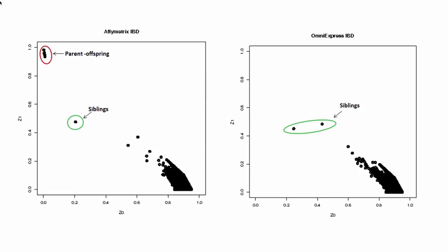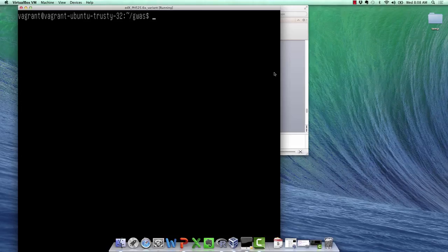Some of our downstream analyses are sensitive to the presence of pairs of close relatives, most notably the principal component analyses for population structure. So we're going to exclude one sample in each of these first degree related pairs using the remove option. We've already created 2 files called samples exclusion OmniExpress and samples exclusion Affymetrix that contain one individual from each of these pairs who we'll exclude.